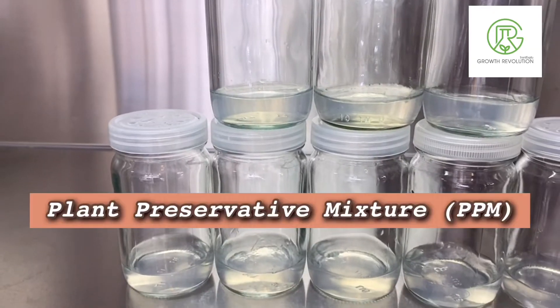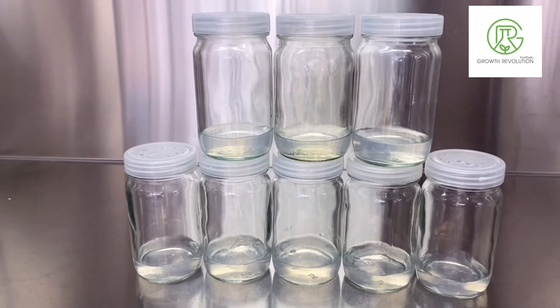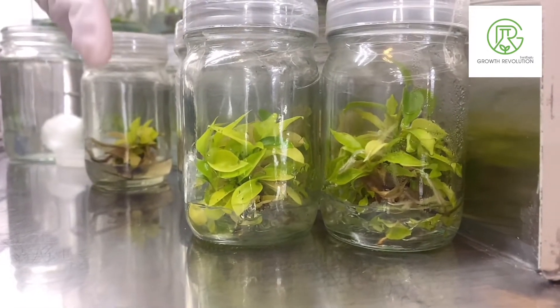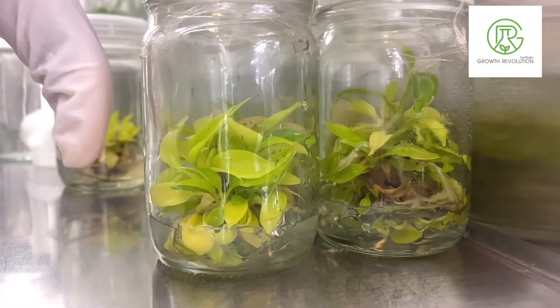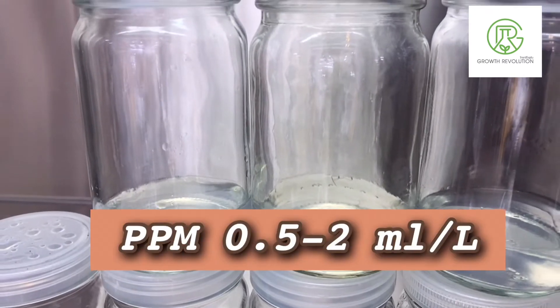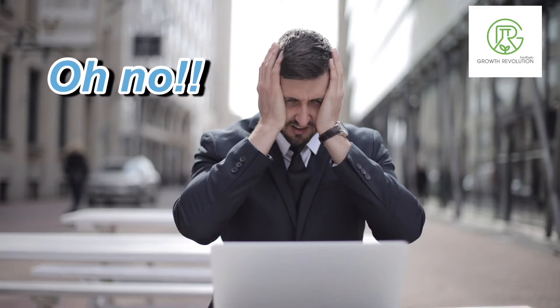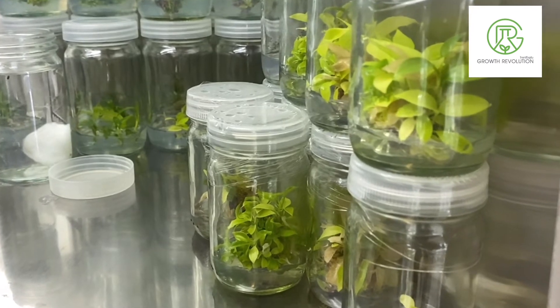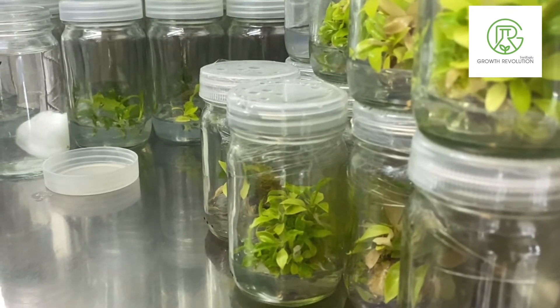The last ingredient we add to our media solution is PPM. We use PPM to prevent contamination in our media, because we don't know if our plant stock is 100% clean. The bad news is that PPM is really expensive. If you don't want to buy it, you just have to make sure that your stock plant is clean and you won't need to use the PPM.